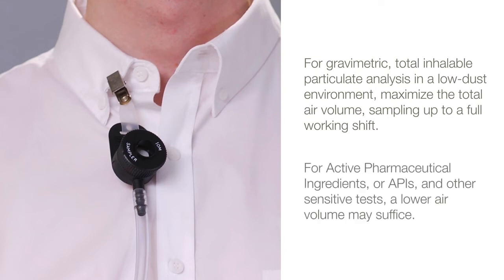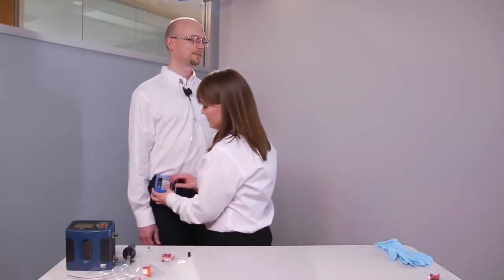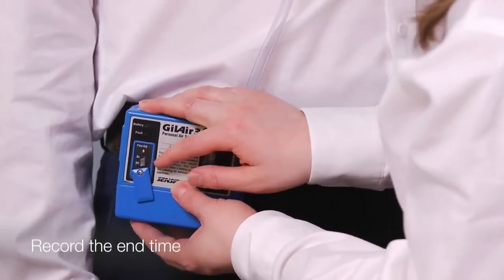Active pharmaceutical ingredients or APIs and other sensitive tests, a lower air volume may suffice. Once the sampling is complete, turn off the pump and record the end time.